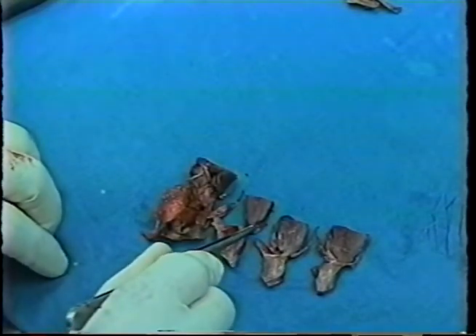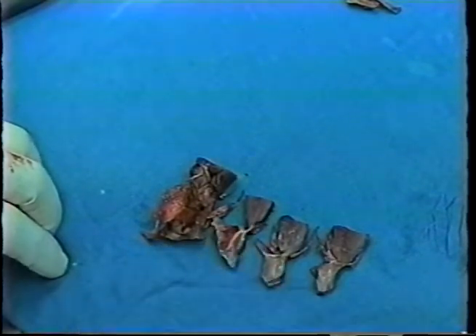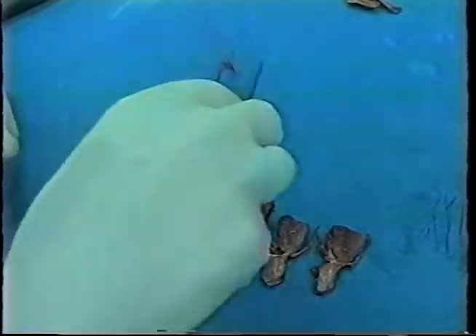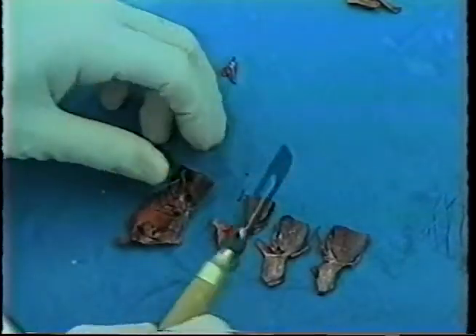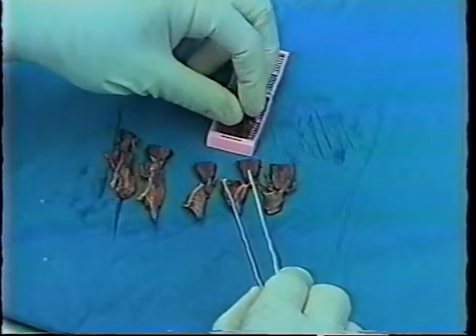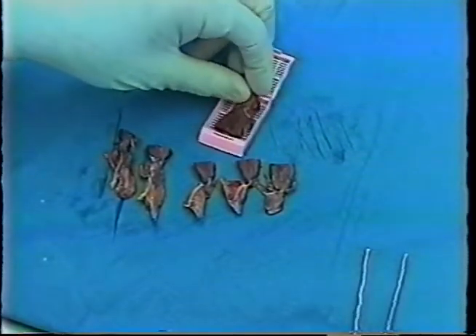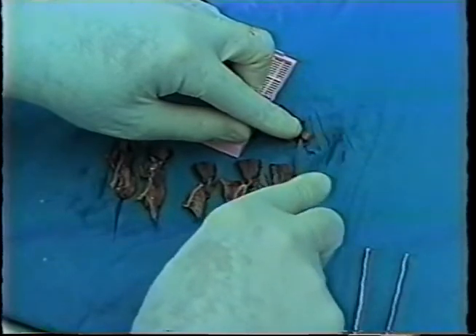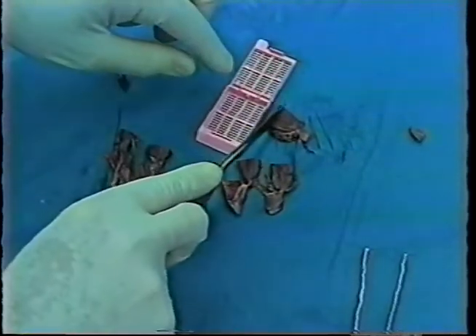Membranous septum is indicated by this very thin, several millimeter length of white fibrous tissue. We load the pieces into the cassette, keeping the original cut side down. Now, some, as this one is, are a bit large. We can afford to cut the top of the piece off to make it fit. We could also cut a little bit, if we had to, of the inferior surface of the septum. But the pieces are then placed in the cassette, as I have done.